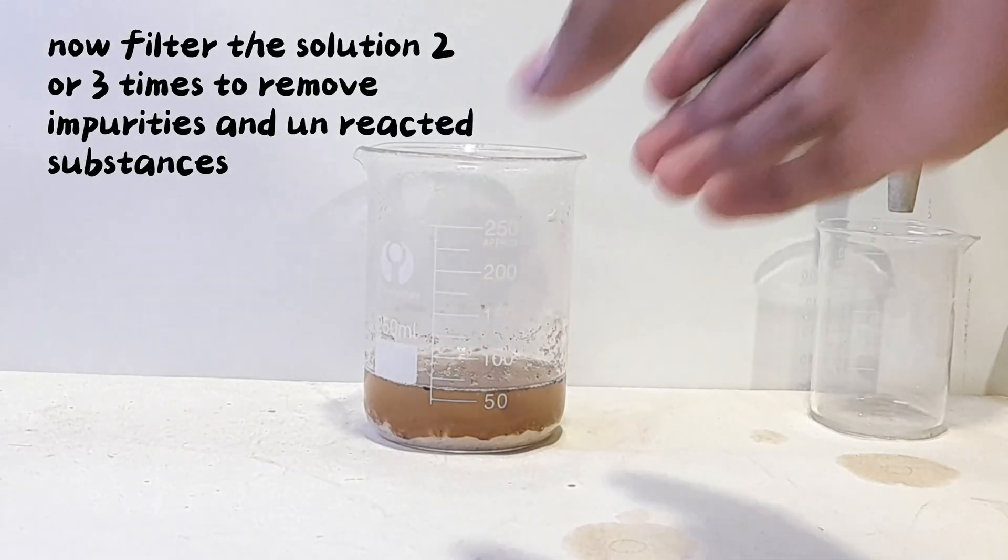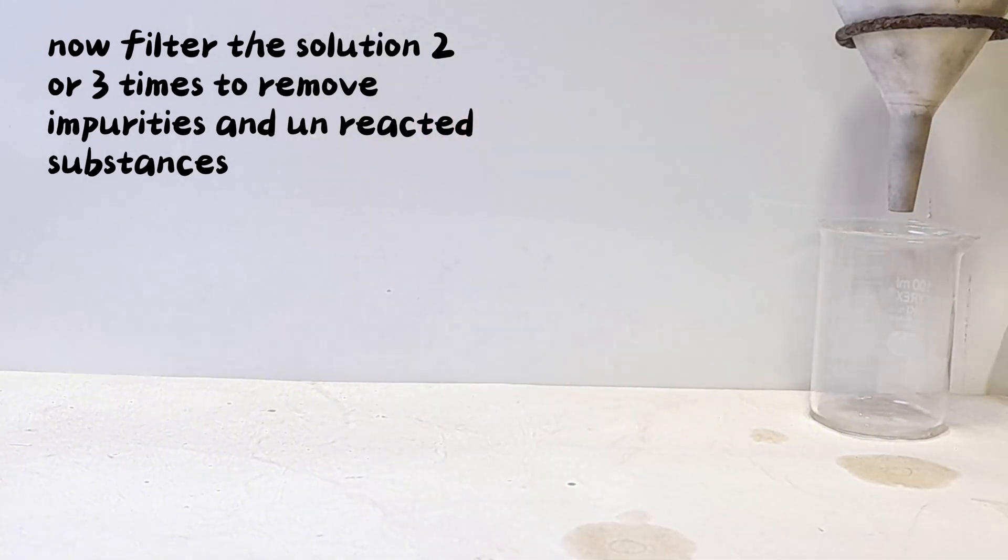Now filter the solution 2 or 3 times to remove impurities and unreacted substances.